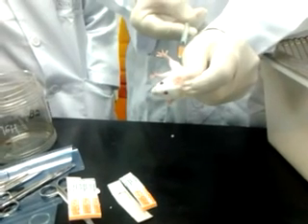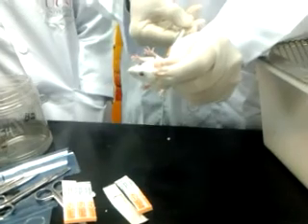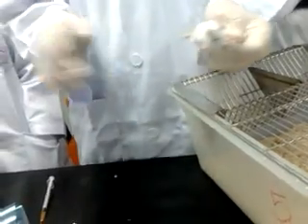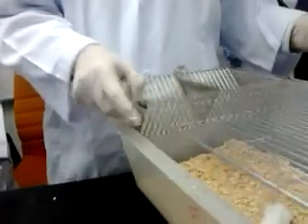Normally we have to put in an alcohol swab and then push in the drug. You see this method you do all by yourself, the animal moving around. We have another method using the cone and then give IM to the cone itself.